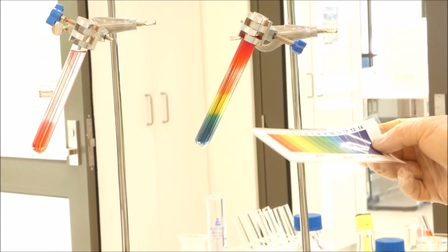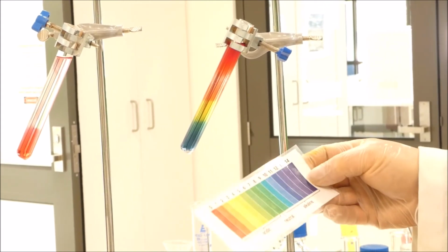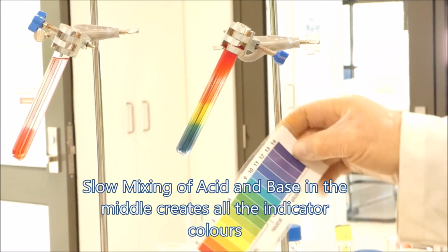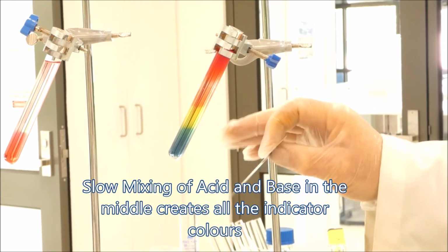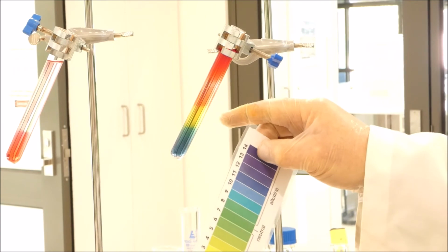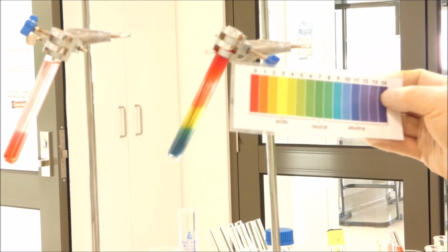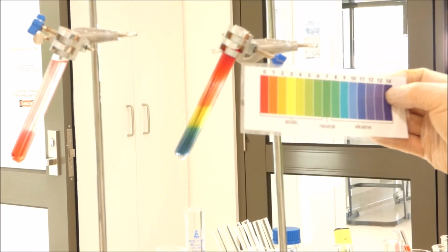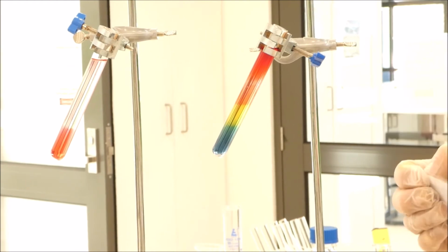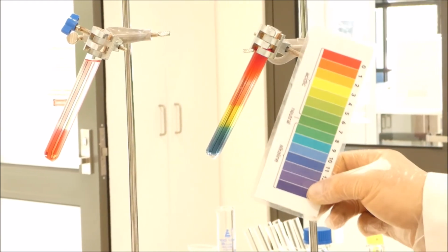And as you go up, the sodium carbonate actually reacts with the hydrochloric acid and neutralises it until you get to a place which is green, about that level there, which is saying it's neutral. Then you go into the yellow zone, which is where you start getting to pH 3, which is becoming more acidic, until you get to the very, very top, which is quite red, which is showing that the top of the solution is still acidic, or still hydrochloric acid and very acidic. But it's a very neat way to show the same sort of colour chart, if you like, in a test tube.